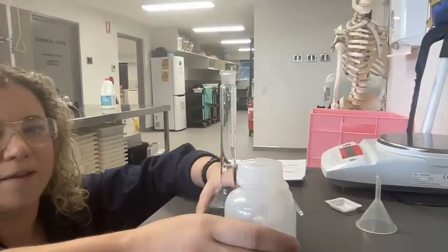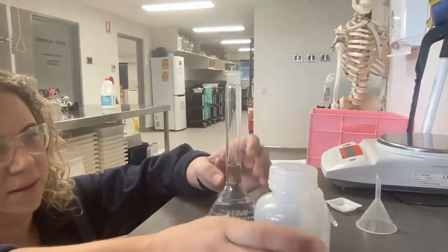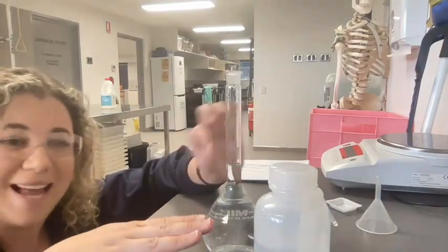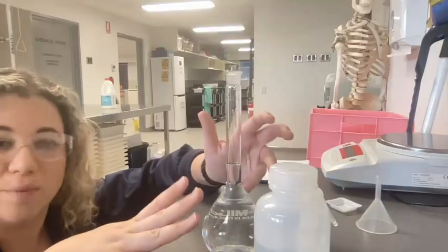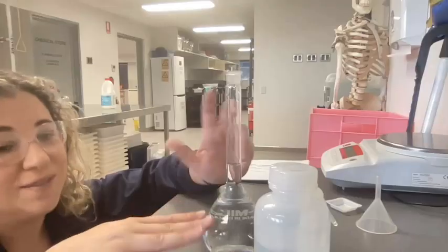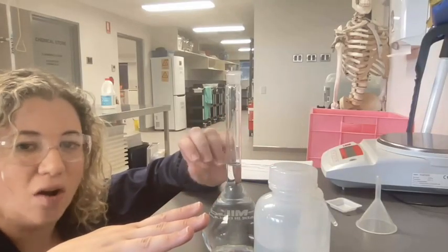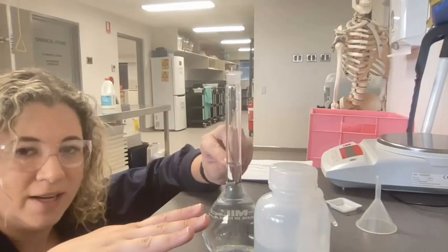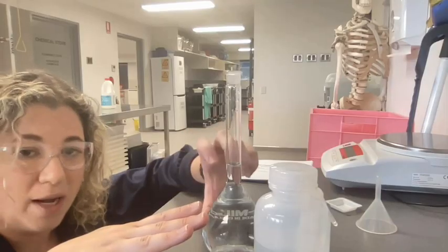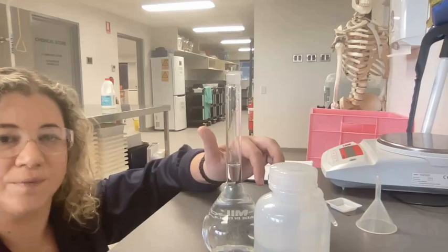Okay. Now, if you go over the exact marking on the flask, then you actually have to start this process all over again, because now you're not exactly sure of the volume. You've got a little bit too much water in, but you don't exactly know how much water you've got extra. So that means you have to start the whole process again. Okay, so you want to make sure that the bottom of the meniscus is sitting on the marker line of the volumetric flask, so that you know exactly how much volume you have, and therefore the exact concentration of the primary standard.